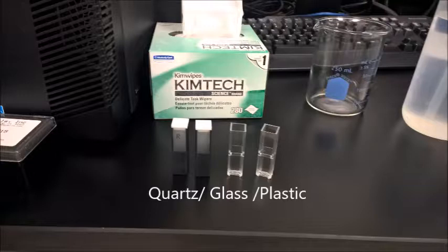A common feature of all these cuvettes is that each one has two opaque opposite sides and two opposite transparent sides. You will hold the cuvettes by the two opaque sides. The transparent sides are meant for the pathway of the UV visible light.